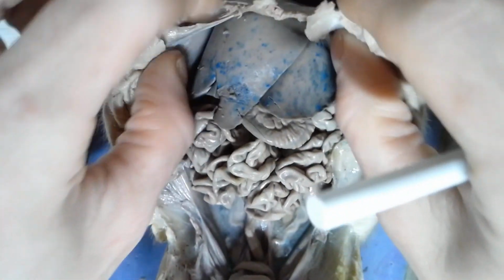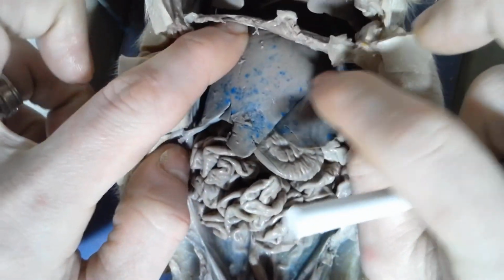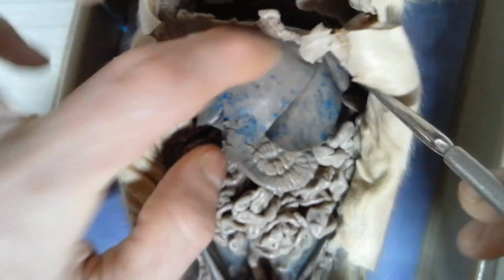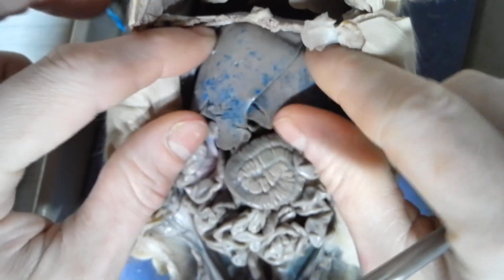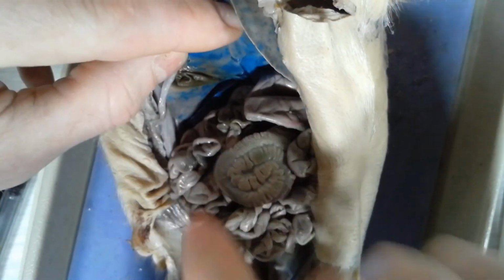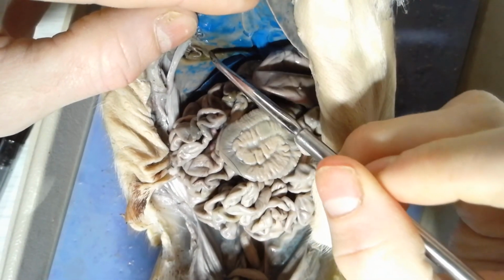Alright, so again, up on top here is the diaphragm. Alright, so let's start off with this, the largest internal organ. All this right here is the liver. Okay, so this is the liver. The liver has several lobes to it, just like the lungs, so it takes up quite a bit of space. Liver. Now if I flip the liver over, you see that little green sac right here. This is the gallbladder. Okay, the gallbladder right there.